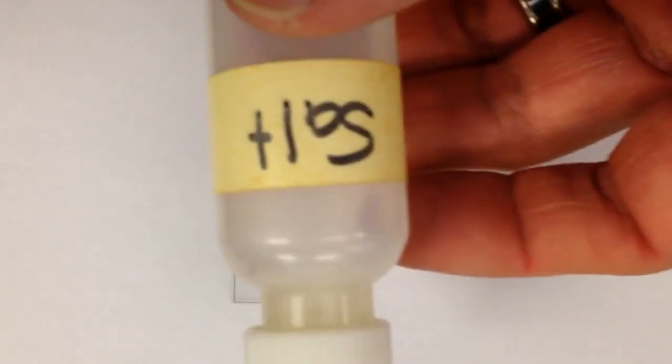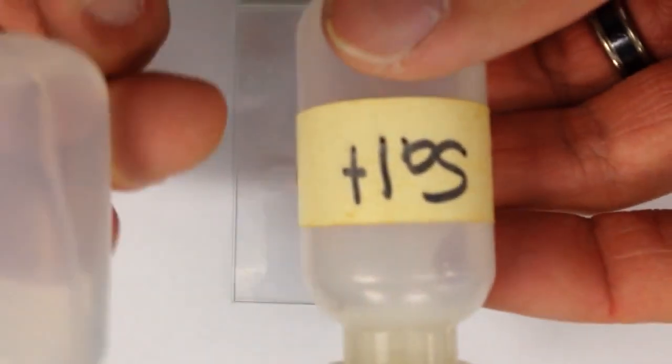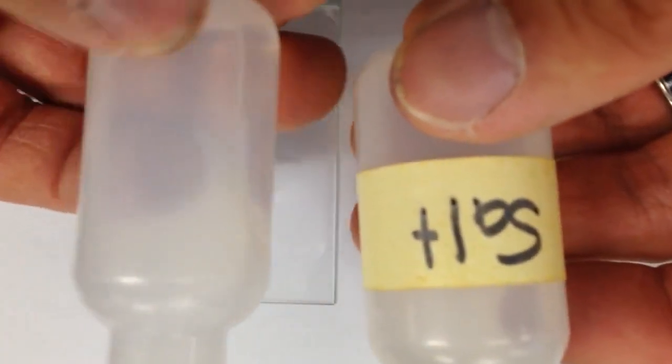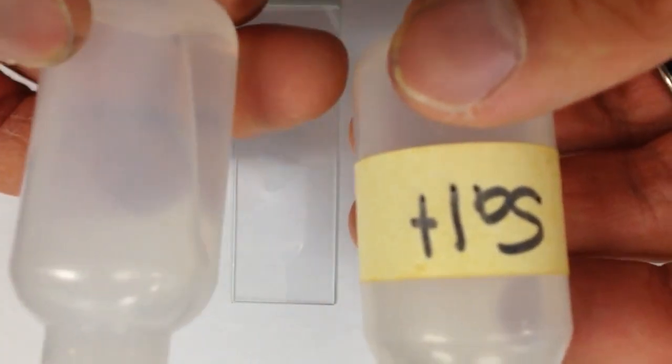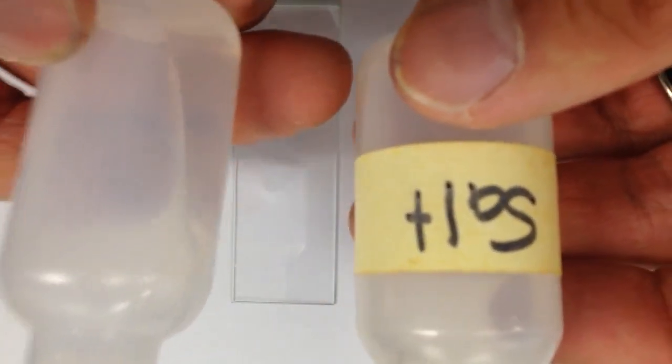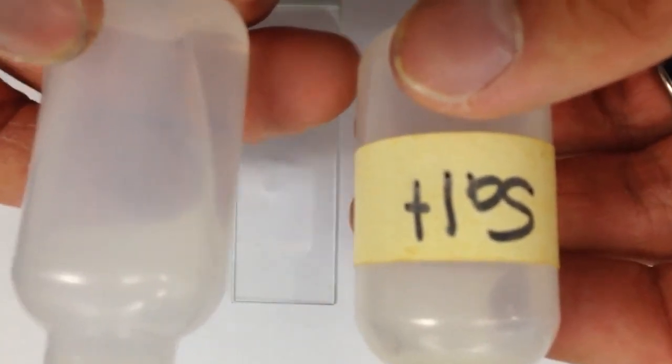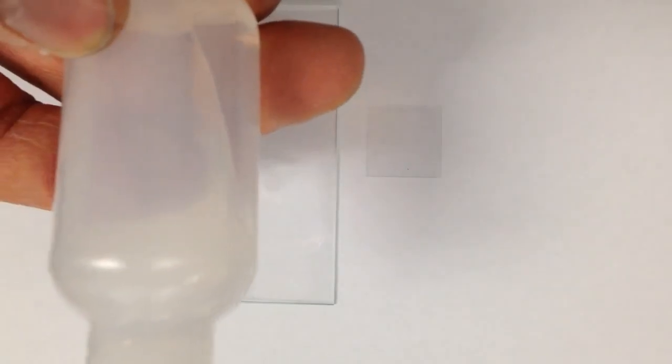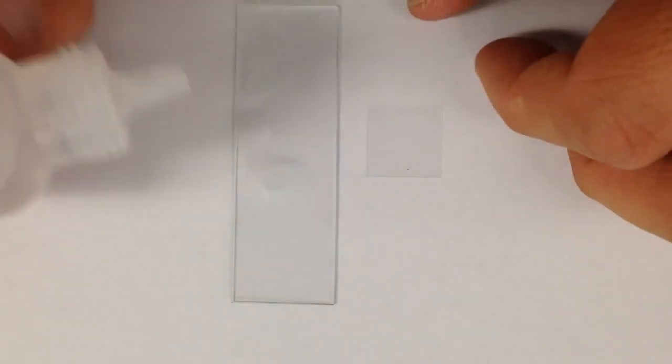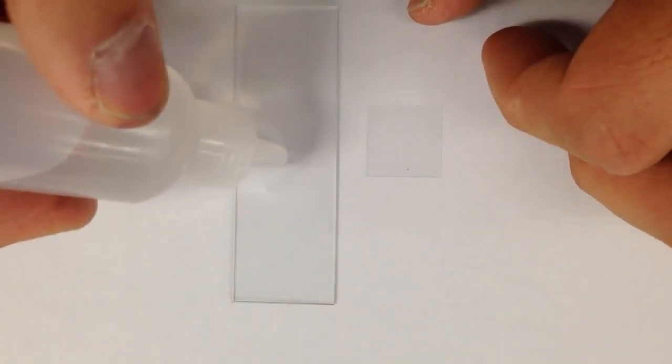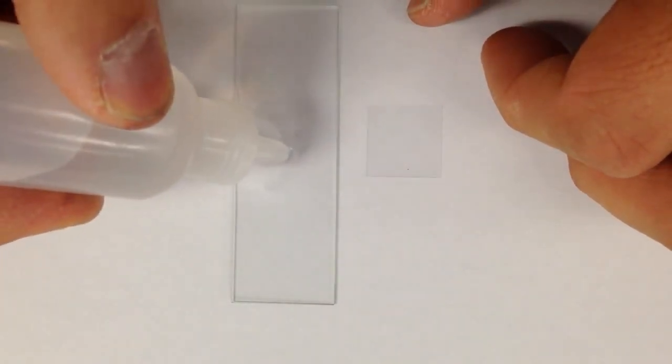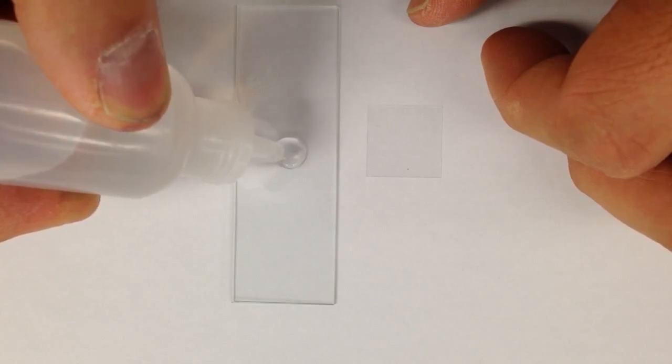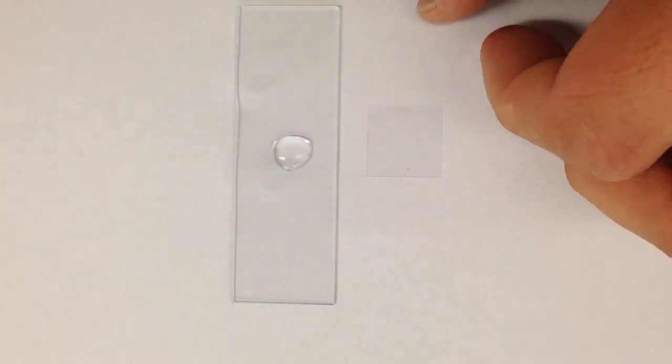Once you get your slides and cover slips out of the baskets at your stations, what you need to do is grab the water bottle. Now, you'll have two bottles, one that says salt, one that may not say anything, or it says H2O on it. So you want to put away the bottle that says salt on it and use the one that says H2O or nothing. And you want to add maybe about two to three drops onto your glass slide here so you can put your specimen in it.